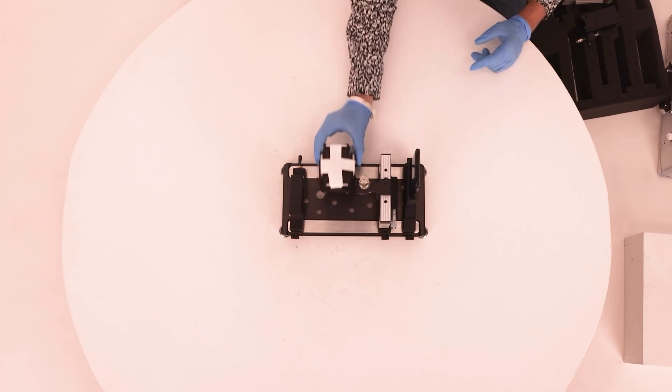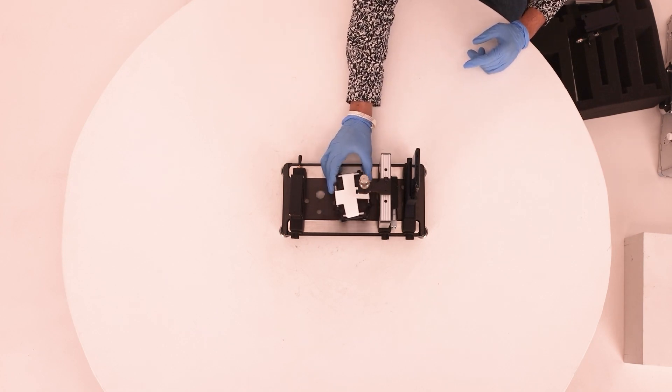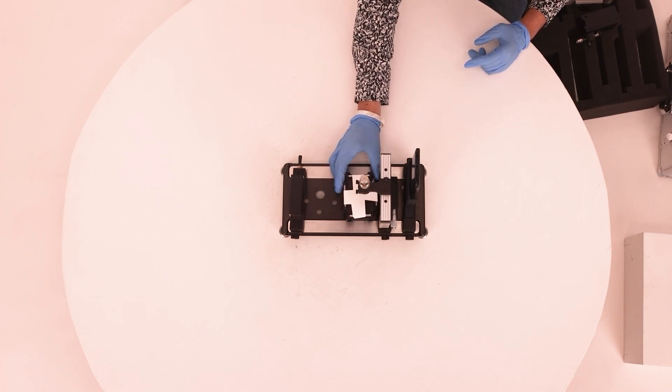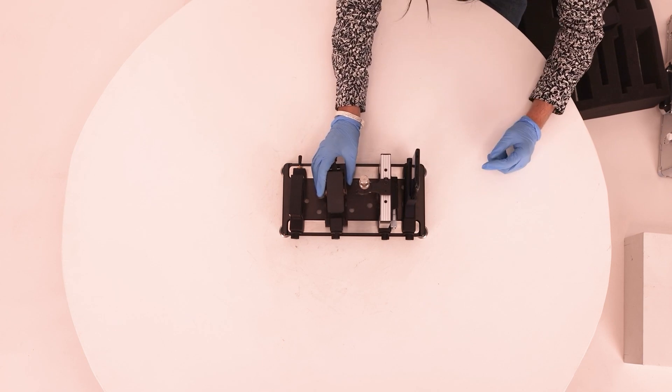Depending on your measurements, the standard SESL stage can be swapped out for the fabric sample holder or the tilting stage.